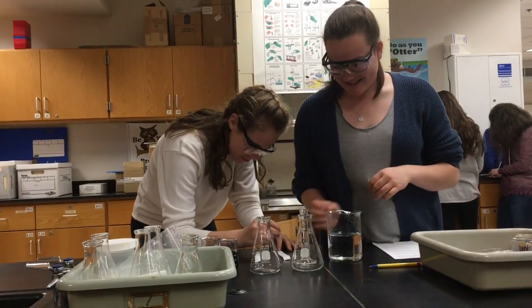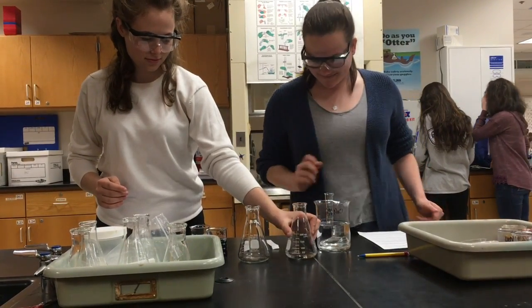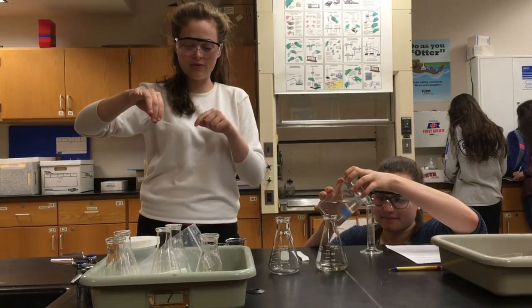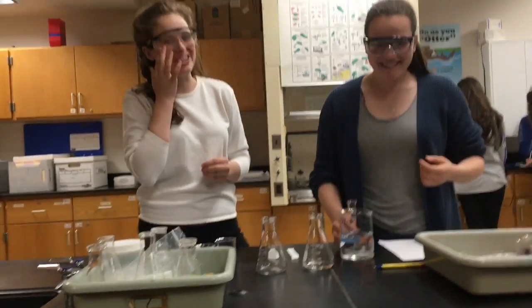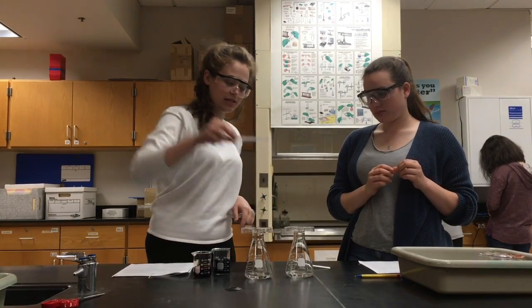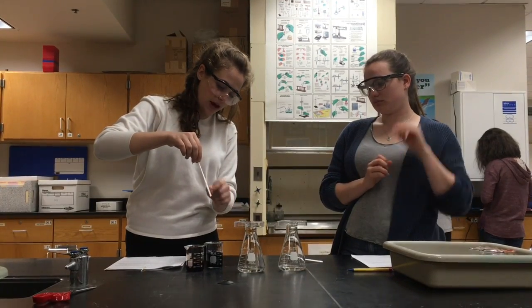We took 20 milliliters of 2% NaCl, and now we're going to put it in this 250 milliliter Erlenmeyer flask. And we're going to repeat that twice. Meanwhile, using these two dyes, blue and red, I'm adding a dot to the chromatography paper, waiting for it to dry, adding another dot, waiting for it to dry, and adding another dot, to make sure our concentration of the dye is high enough that we can get some nice results. Just the bottom touches. We don't want the dye to touch the solvent directly, otherwise it'll just go into the solvent. And then we're going to record how far up it goes.